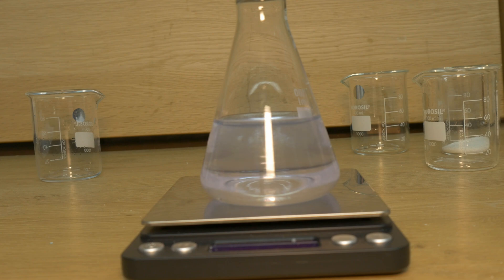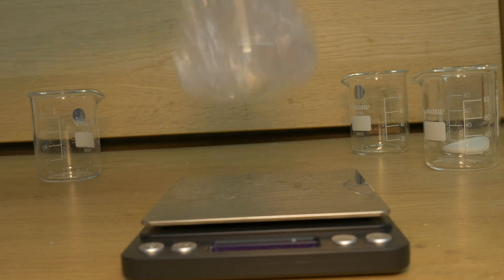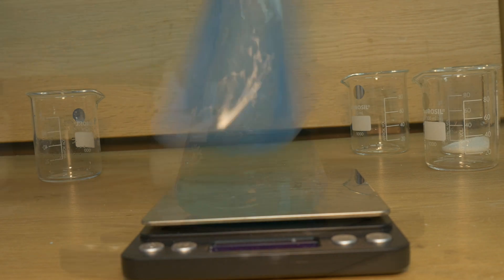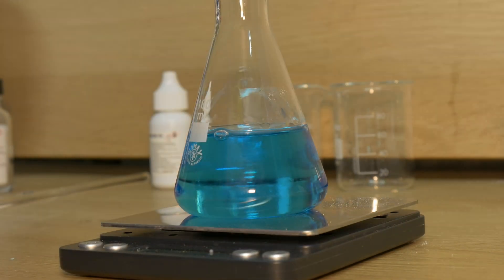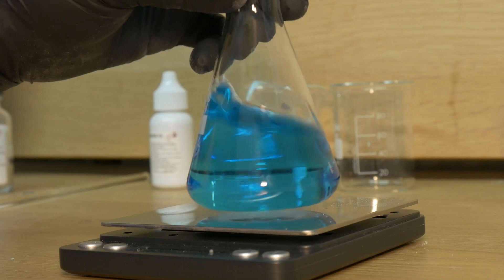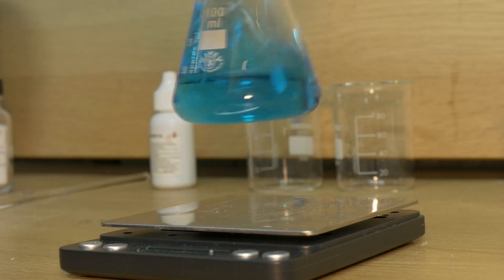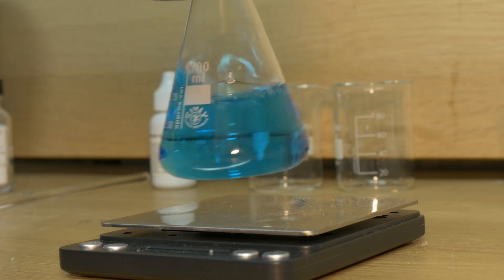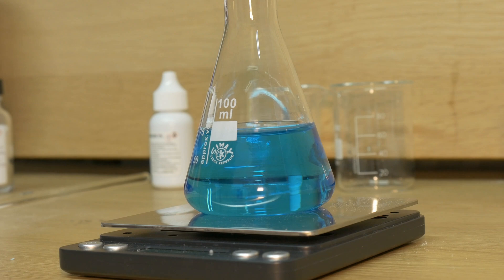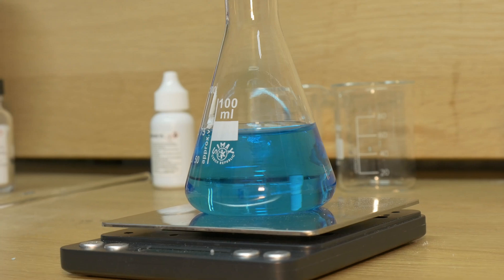We decided to do the same with sucrose. However, sucrose does not behave in the same way because it is a non-reducing sugar — it cannot donate electrons, as it lacks the free aldehyde or ketone group that would allow the transfer of electrons. Therefore it cannot reduce methylene blue back to its colorless form. As you can see, if we use sucrose instead of glucose, the reaction does not proceed as expected, and the solution remains blue after the initial oxidation.